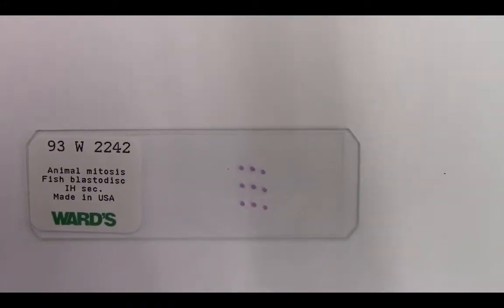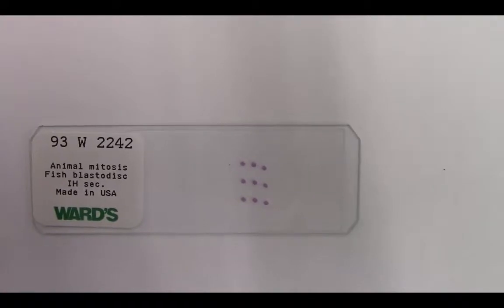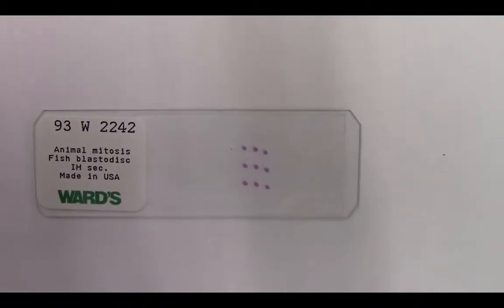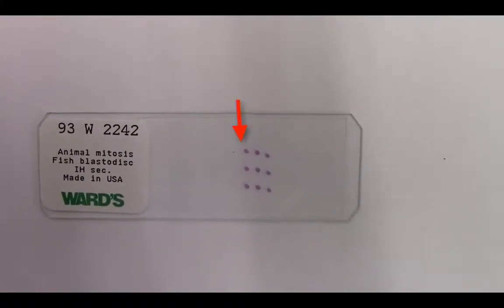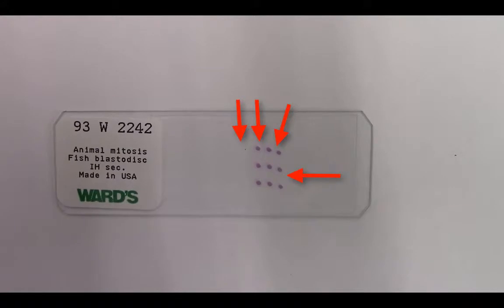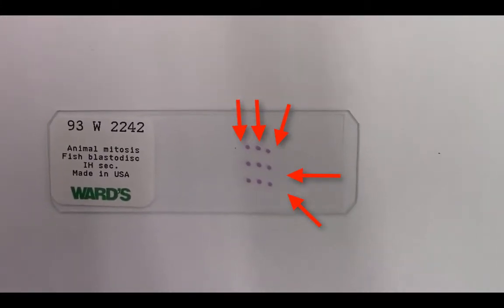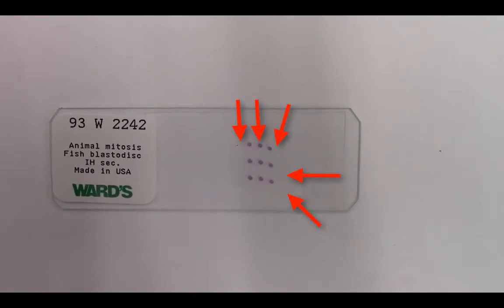Mitosis is also the process by which animal cells set up their body plans. You'll also examine these whitefish blastula sections — there are 9 sections in total — where you should be able to see cells in the various phases of mitosis.